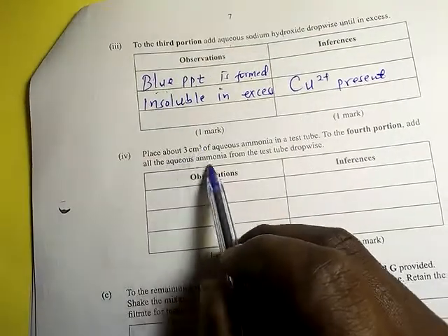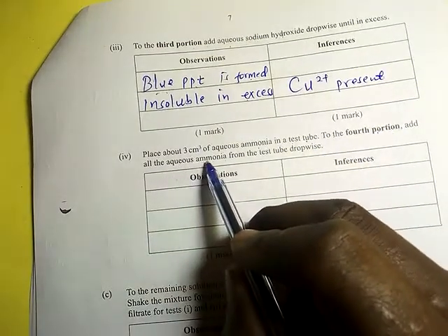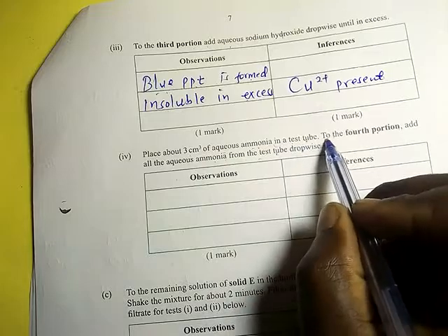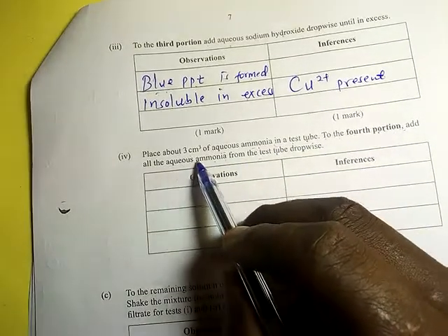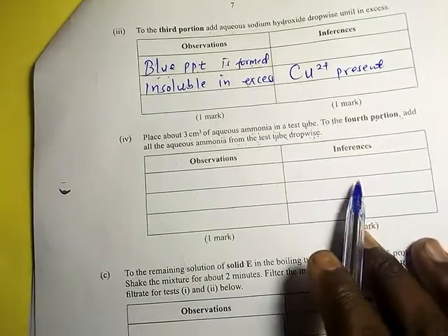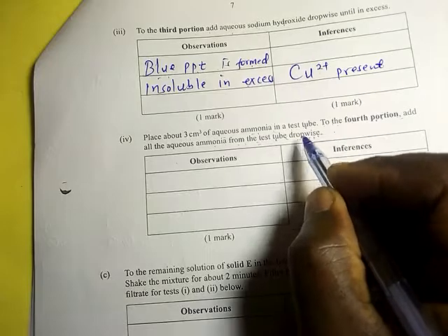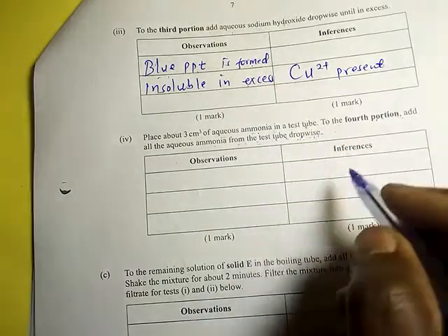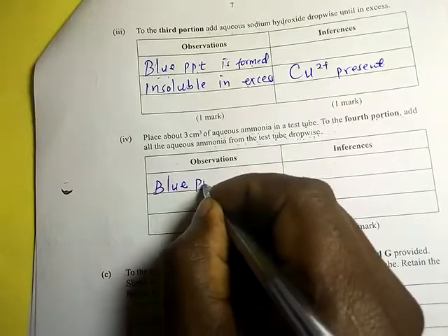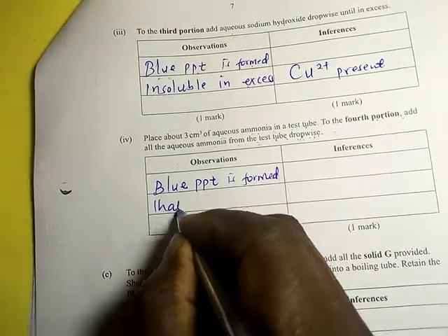Place about 3 cm³ of aqueous ammonia in a test tube. To the fourth portion, add all the aqueous ammonia from the test tube dropwise. When adding dropwise, you don't expect instructions to say 'until in excess' — you add drop by drop and then end in excess. Here, a blue precipitate is formed.